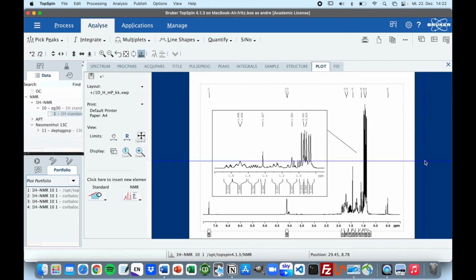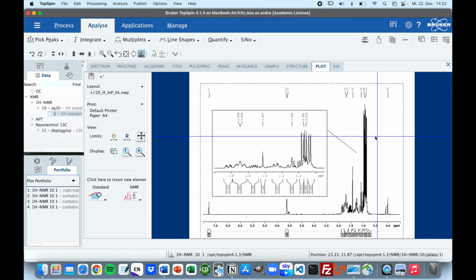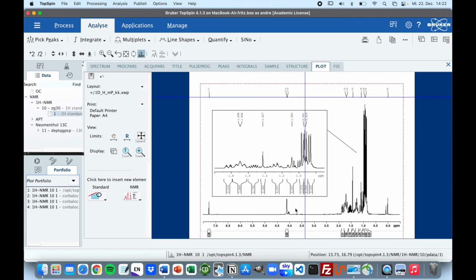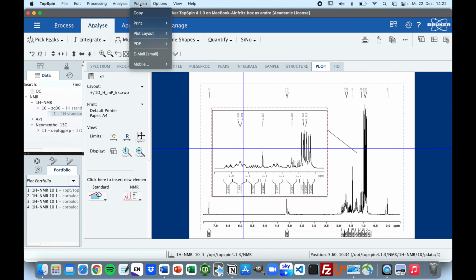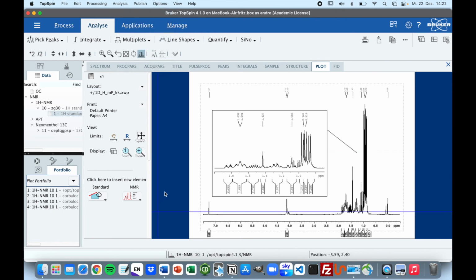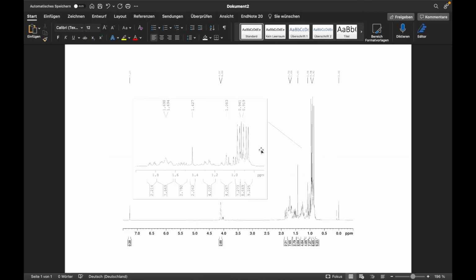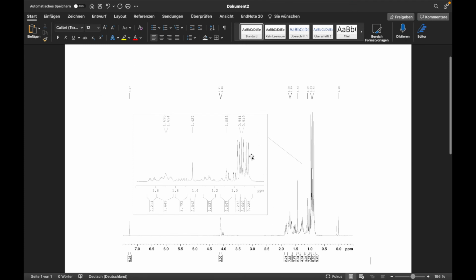So now I will say, okay, this looks pretty decent. We can now go on and export this picture. So everything we are going to see here is going to be in the final file. So we go to publish. You can either print it or save it as a PDF. I will just copy it, just for convenience, and I can paste it in here. So as you can see, the layout looks pretty professional. We have our inlet, so we can really see everything we need to see.